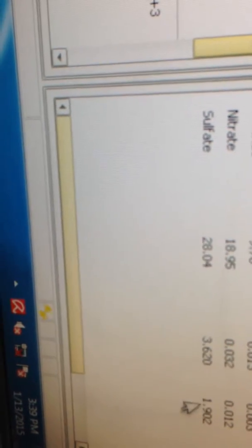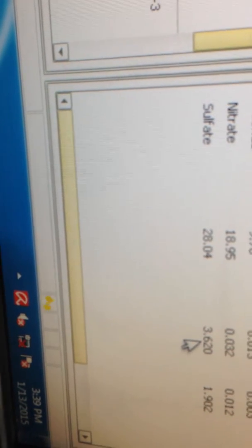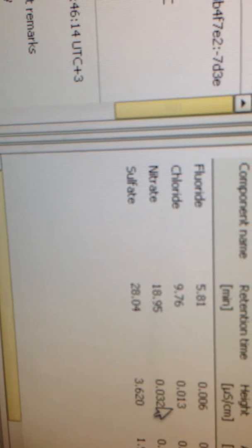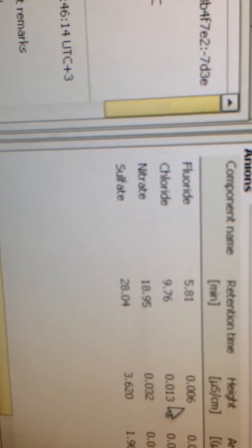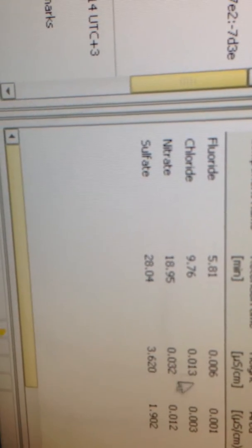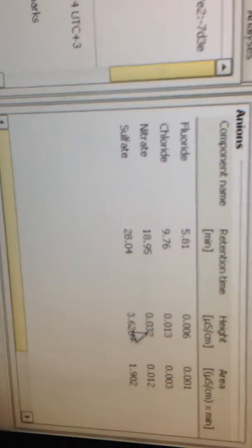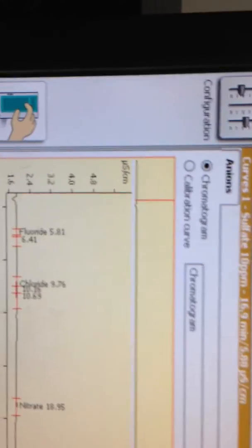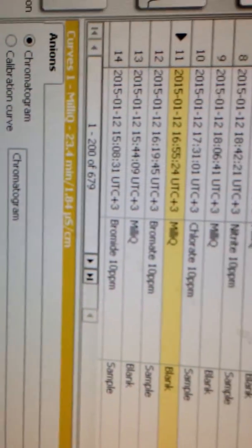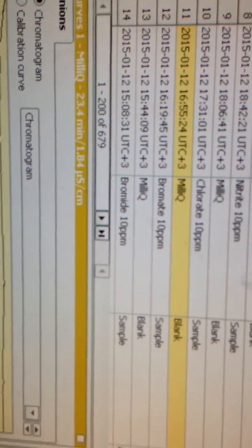The results are shown here on the table. For sulfate, the height is 3.6, and it says nitrate 0.032, chloride 0.013, and fluoride 0.006. If you compare that to this, it's nothing, but it says there is something there, so maybe there is a contamination. It looks like it's not carrying over, because in between them there is water, and in the water there is nothing there. It's empty. It's not identifying. But I think there's a contamination in the standards.